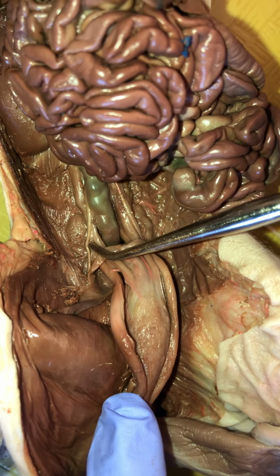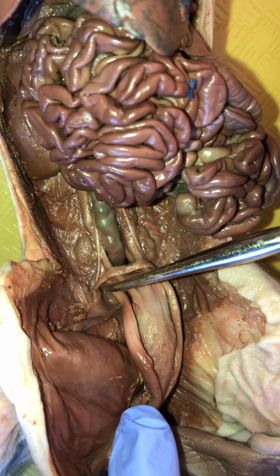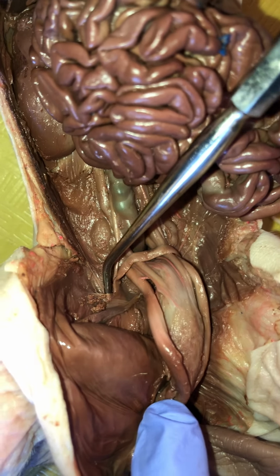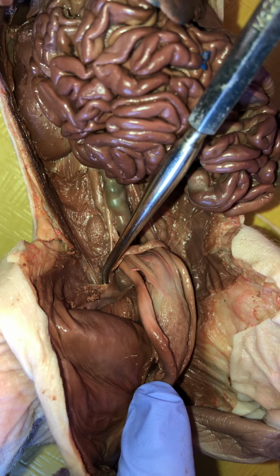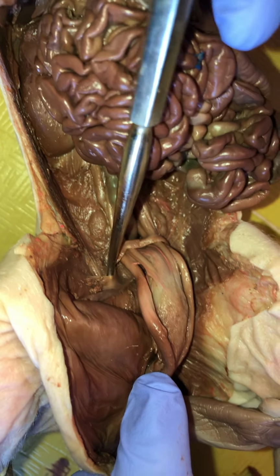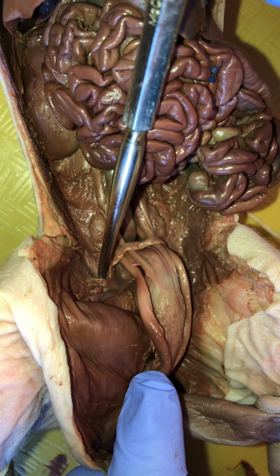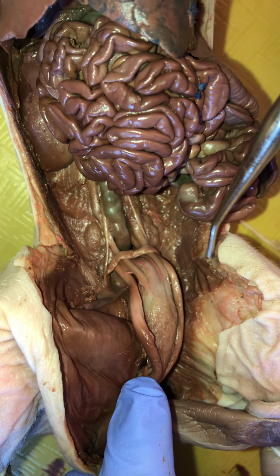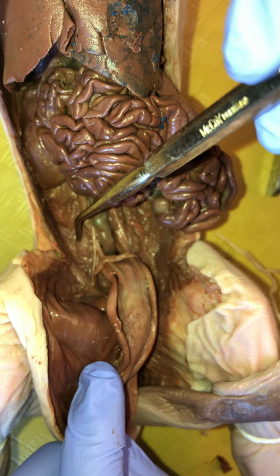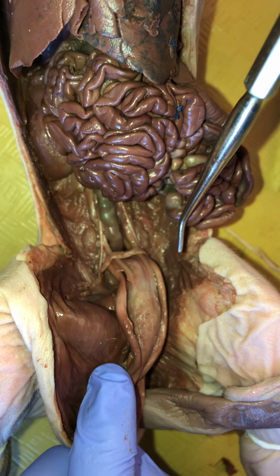And then this right here, we're going to have nerves and blood vessels we're going to be able to see kind of coming down with this tape-like thing and into this hole. Yes. So this right here is the internal entrance to the inguinal canal, right? And notice I can put my probe down there, okay? And if it wasn't bent, I would be able to put it all the way down to where the testes are, all the way down into the scrotum. And so this male's testes have already descended, which meant that they formed up here, and then they got pulled all the way down through here.